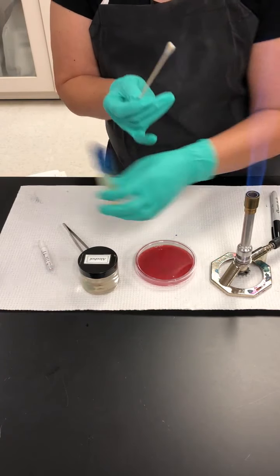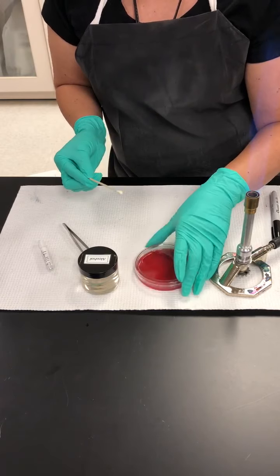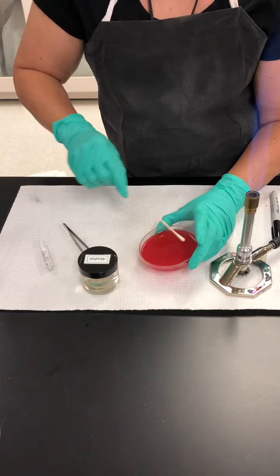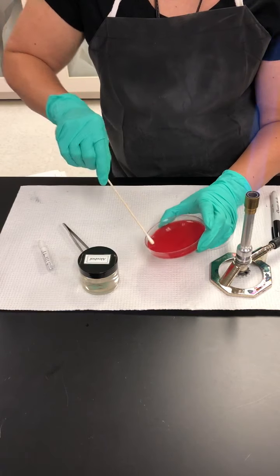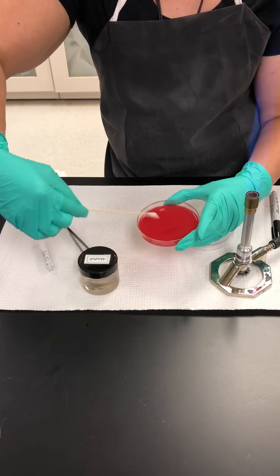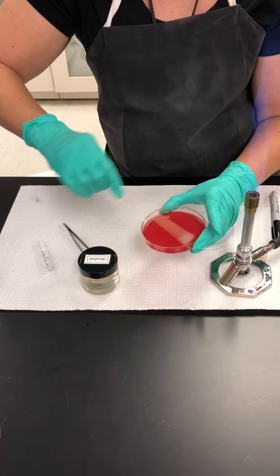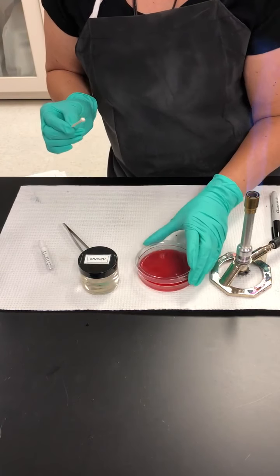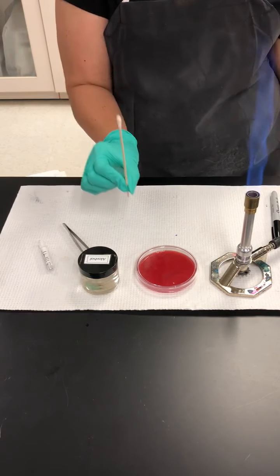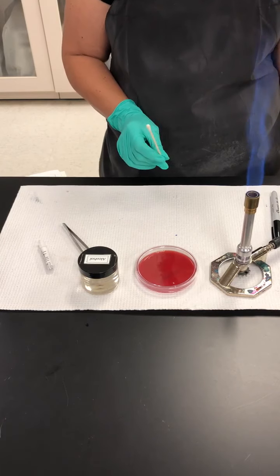And I'm going to transfer to cover most of the surface of the blood agar. It's kind of fun, it's very artsy. I do it in both directions. I want to make sure that I have bacterial growth all over the surface of the agar. And now this is ready to go. I'm going to dispose of my swab in a pipette box. Swabs that have bacteria like this should not go in the trash.